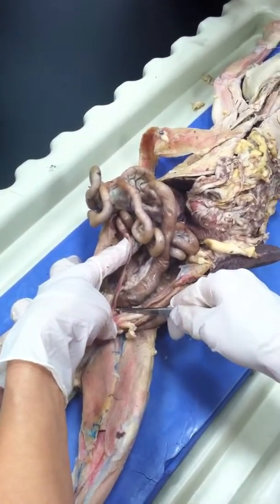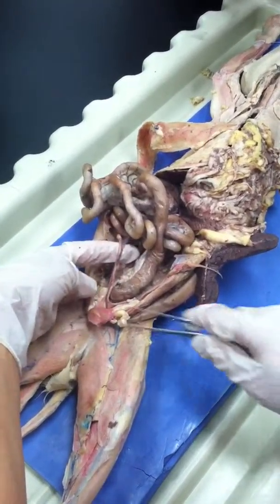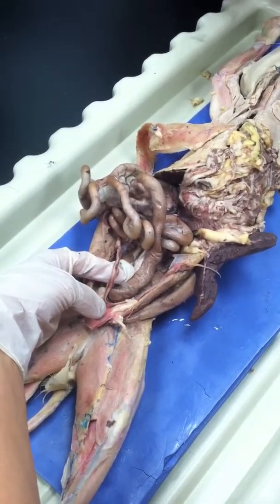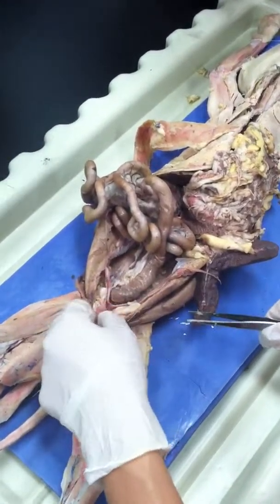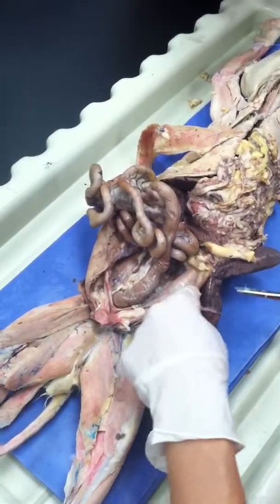Unless that could be the bladder, but it's too small. We think that this is. No, this is the bladder. And the uterus is the end of the two tubes. So yeah, this is the bladder. Lower down. Yeah, this is the bladder. Where's the bladder now? The big thing. That is the bladder. Mm-hmm. And see, they enter right there, yes, and these are the two tubes and the ovary again.